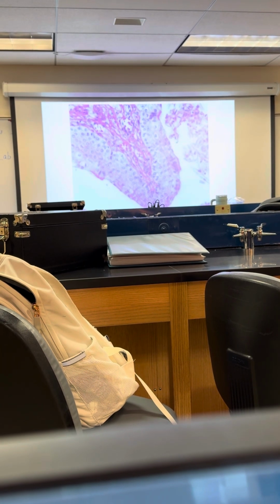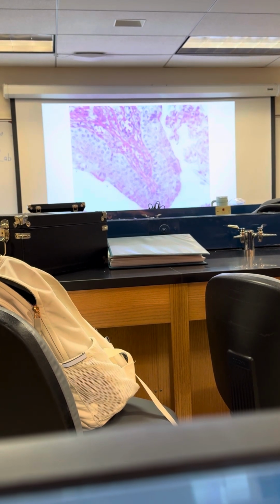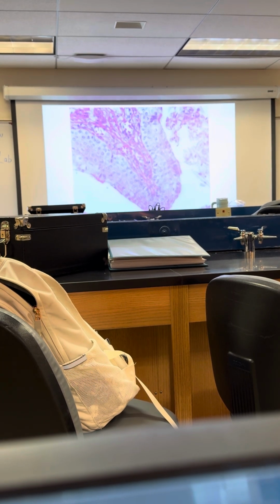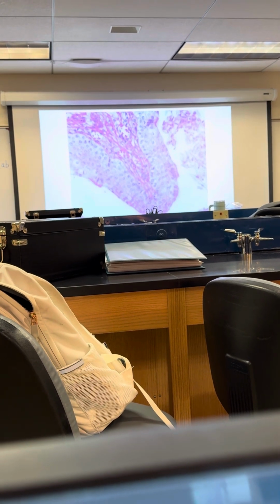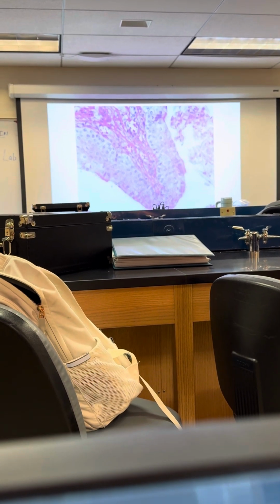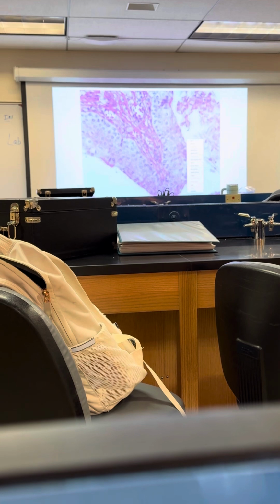Does this one have keratin on it? No. So it is non-keratinized. Where do we have the keratin type? We have it on the soles of the feet, the skin surface. So let's do that one real quick. Is this helpful? Hopefully. Okay, because I know you guys are going to have this next week, so we'll do it real quick with you guys. Okay, so here we are.